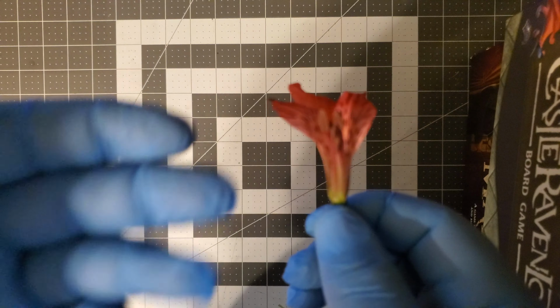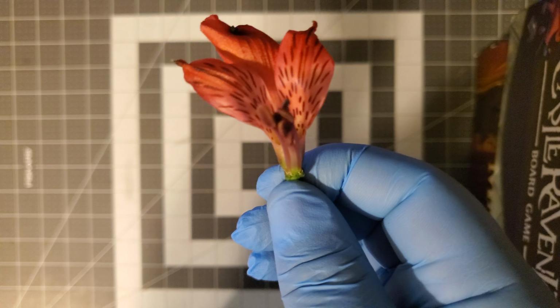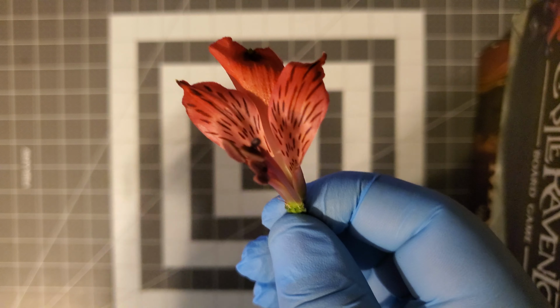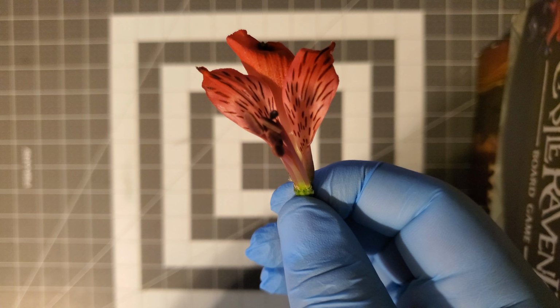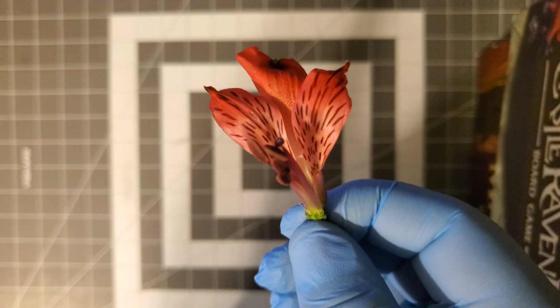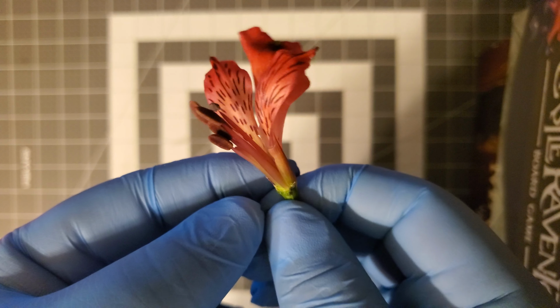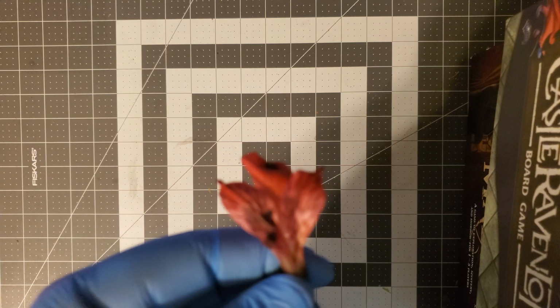So, as I said, the flower is quite colorful. It's red, it's vibrant, and that's because of the petals. These are definitely meant, without a doubt, to attract pollinators. It is a beautiful color, so I suspect it gets a lot of visitors. This type of species definitely gets a lot of visitors from a variety of insects.